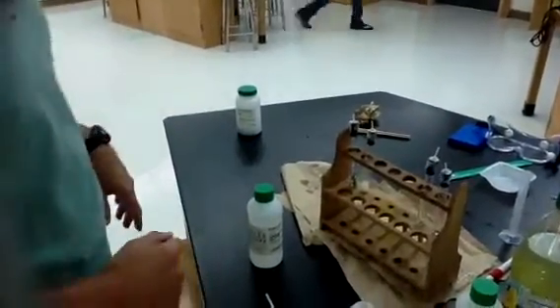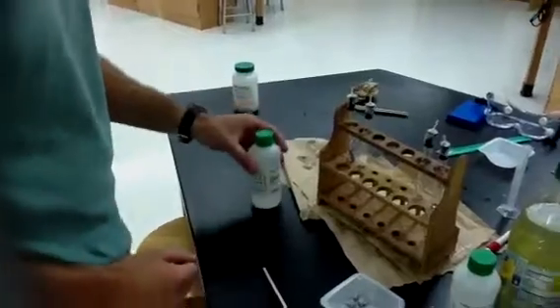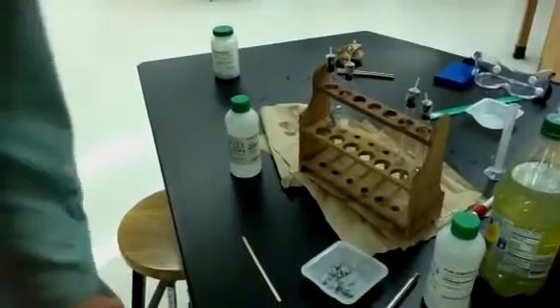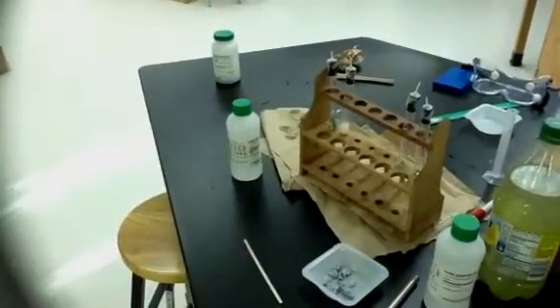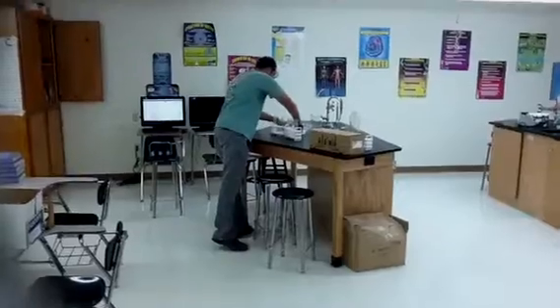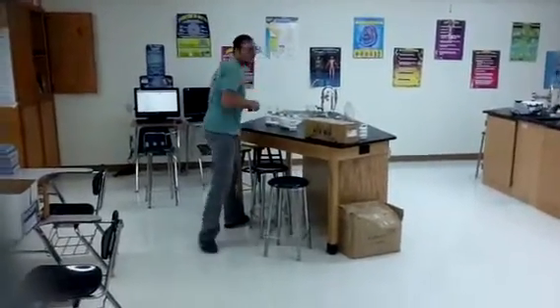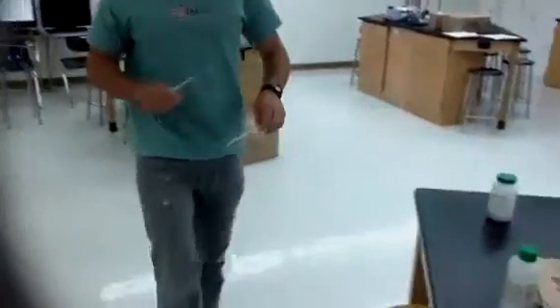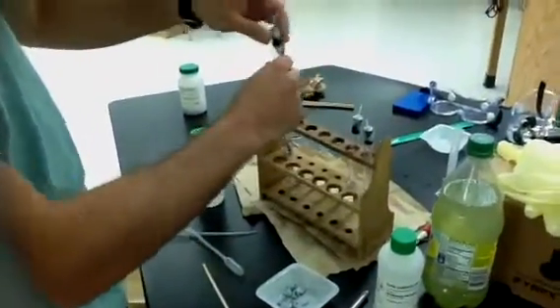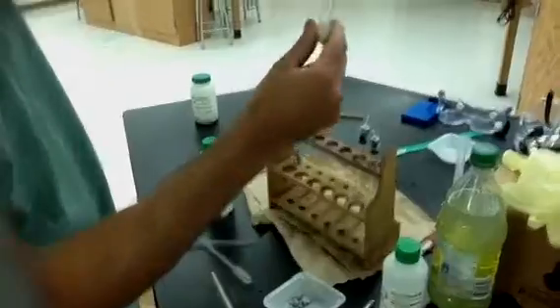All right, so ladies and gentlemen, now in order to generate this gas mixture, I am going to need a couple things. I'm going to need a couple of pipettes. I'm going to go and grab those right now. Got my two pipettes. Pipettes are obviously very important. And I'm going to start my gas generation. First generator I'm going to start is my oxygen gas generator.